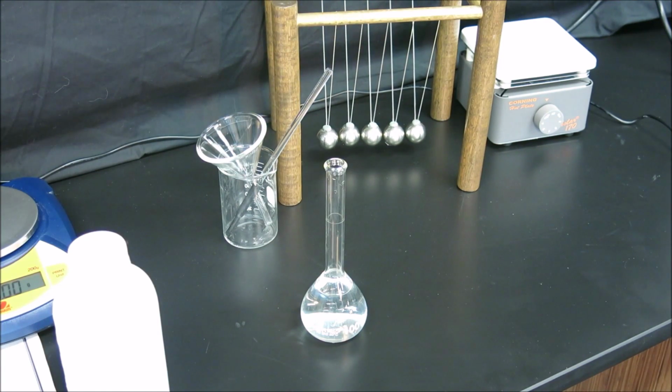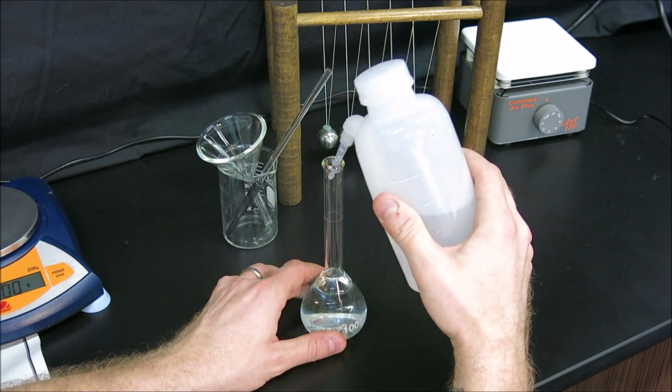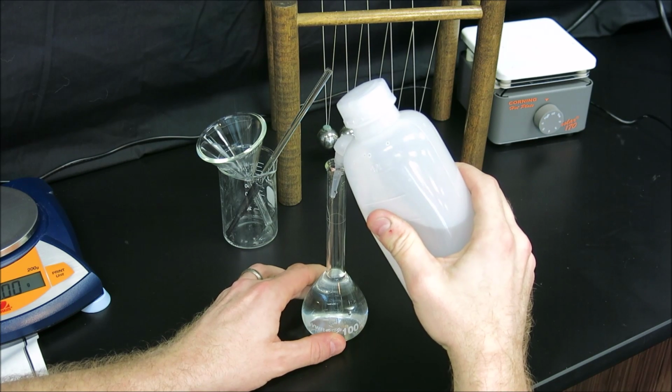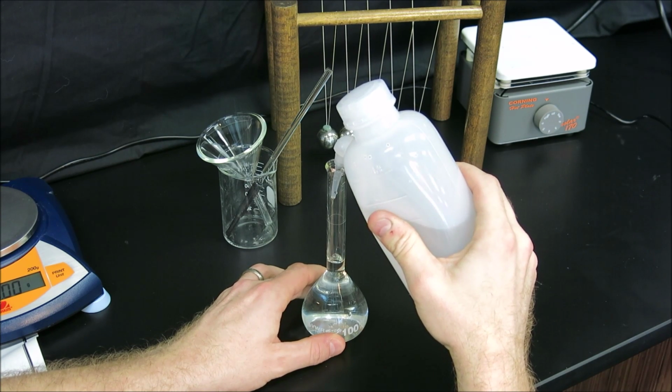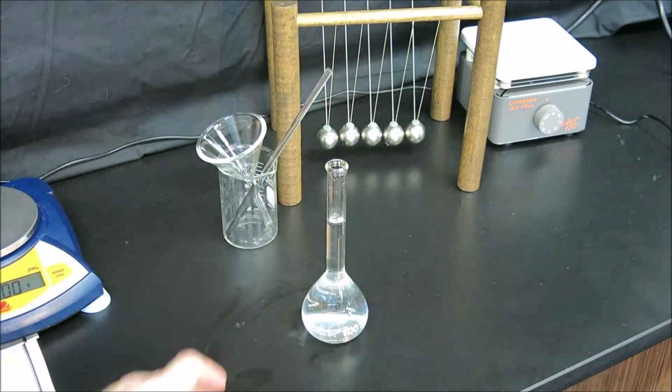And now we just need to top up the volume to the line. It is important when filling to remember the neck fills much faster, and also to bring your eye level down to the level of the line in the flask to avoid parallax when reading the meniscus line in the flask.